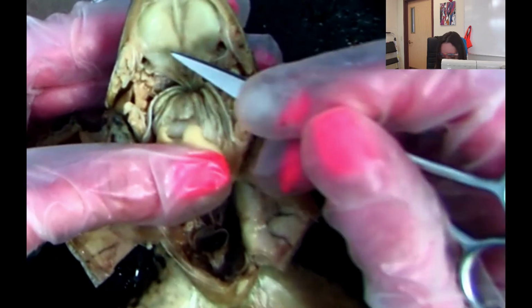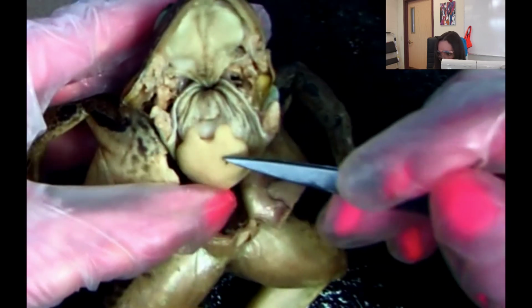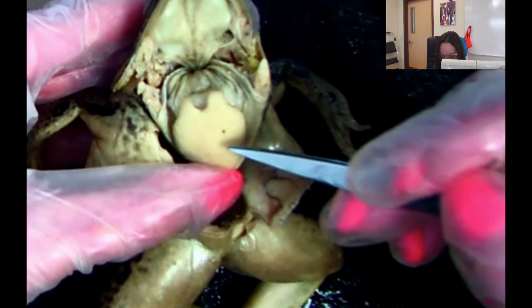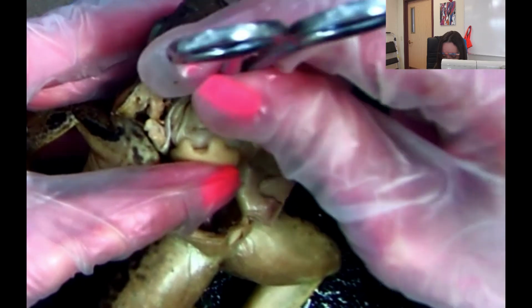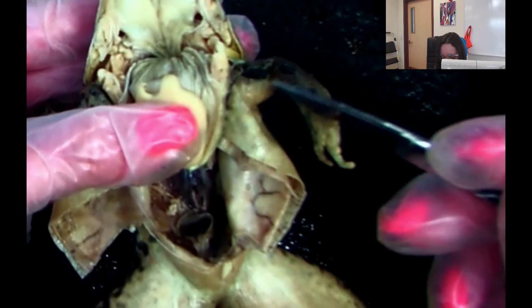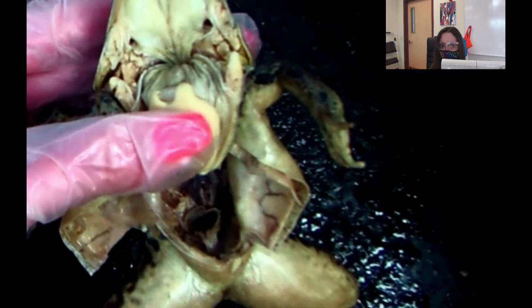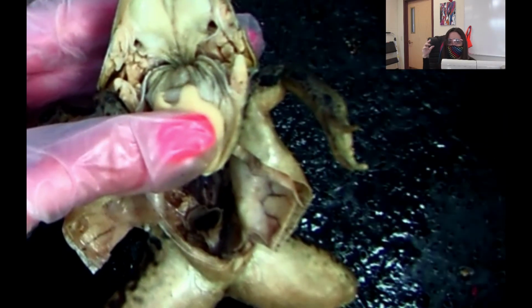You can really see it. There we go. These two holes are called the Eustachian tubes. This right here, good job, it's the tongue. And then what's this right here? Put the scissors down it. That's the esophagus. Good job. Okay, so those are the mouth parts. So hopefully you guys could see them. Hopefully this was a good visual for you. We're going to go ahead and get into the internal features, so let's go ahead and do that.